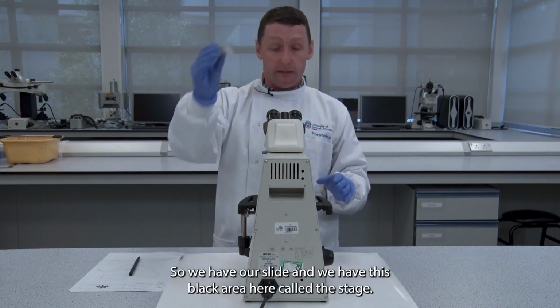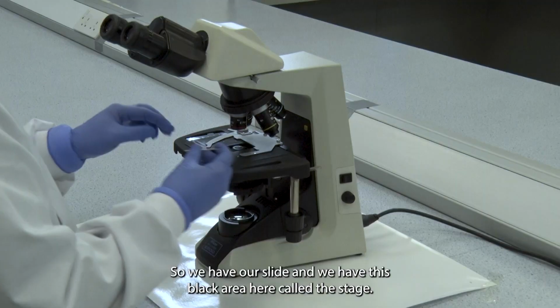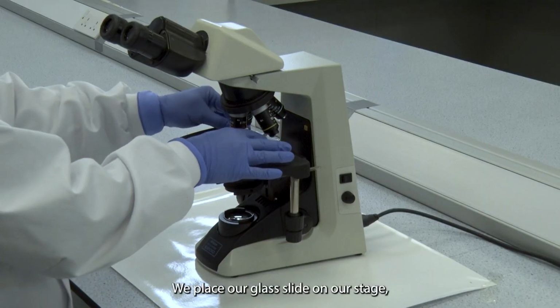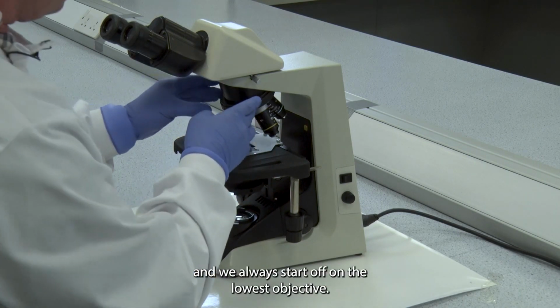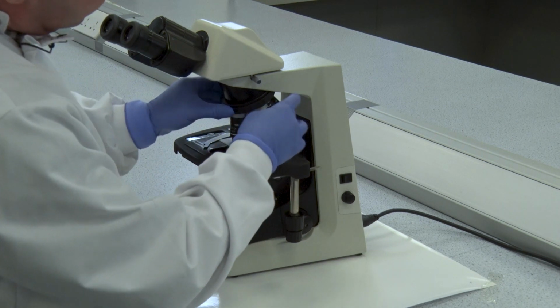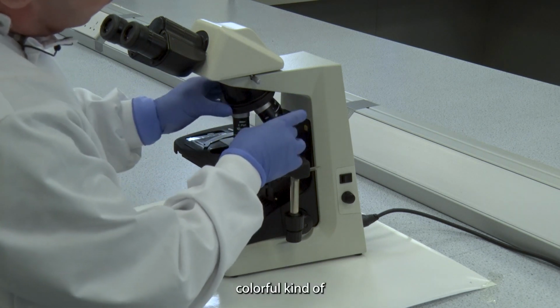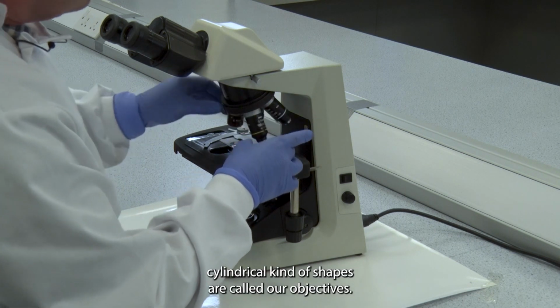So we have our slide and we have this black area here called the stage. We place our glass slide on our stage and we always start off on the lowest objective. These colourful cylindrical shapes are called our objectives.